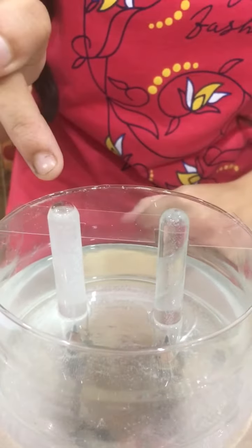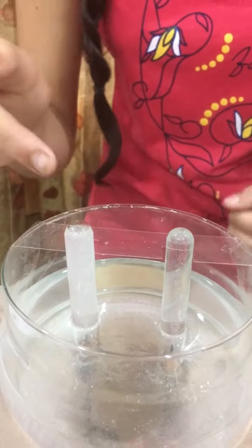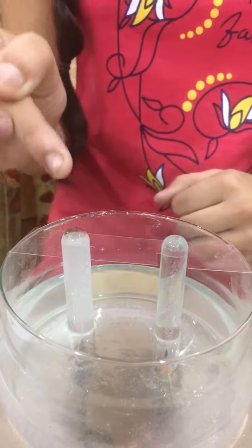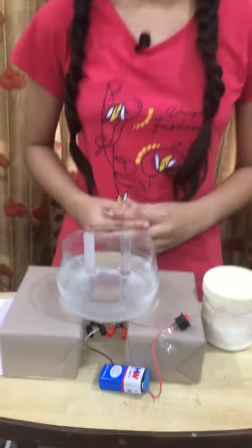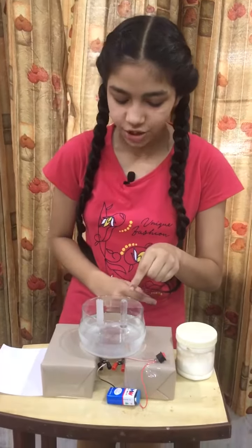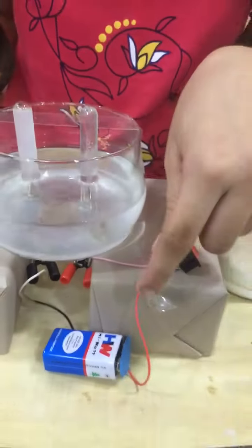Here is hydrogen gas and here is oxygen. We can also see that the test tube in which the hydrogen gas is forming is attached to the negative terminal of the battery — that is the cathode. And the test tube in which the oxygen gas is forming is attached to the positive terminal of the battery — that is the anode. Thus we can say that hydrogen gas always forms at the cathode, and oxygen gas always forms at the anode.